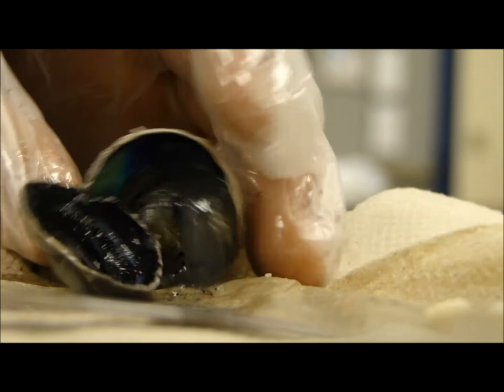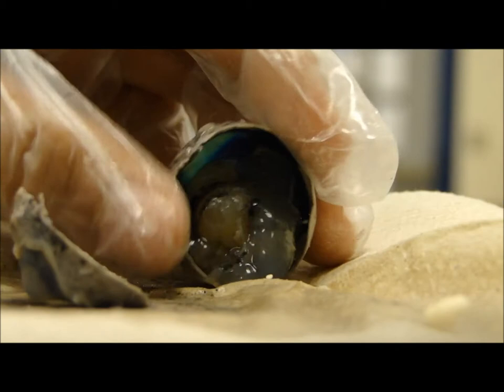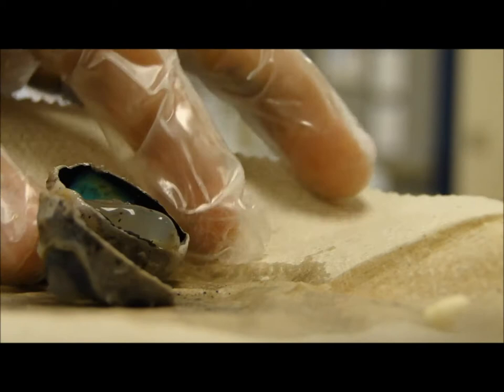So that gray thing is the vitreous body. Oh my gosh. You can — I'm gonna get started. Yeah. Look at the eye. Looks like a jellyfish. It does. Look at how cool the blue looks at the back. Oh dude, that's so cool.